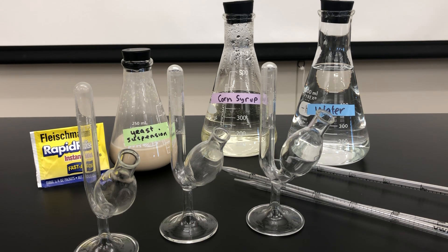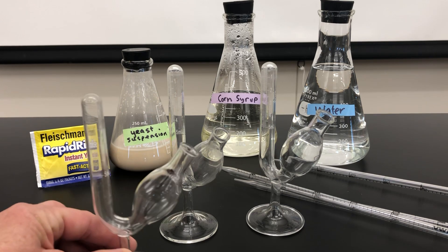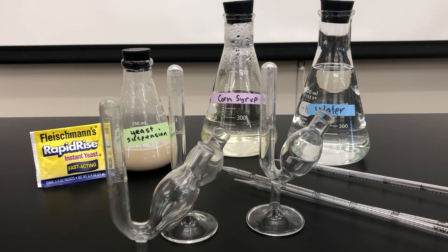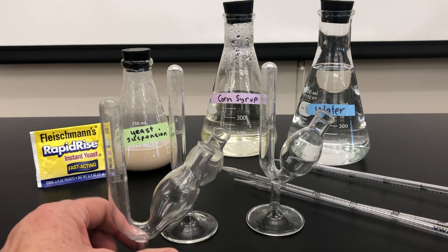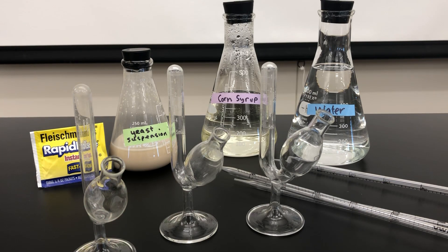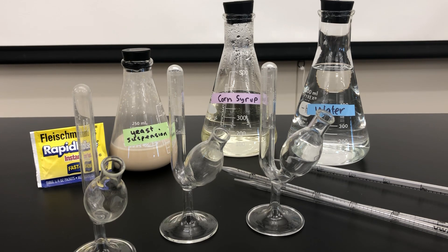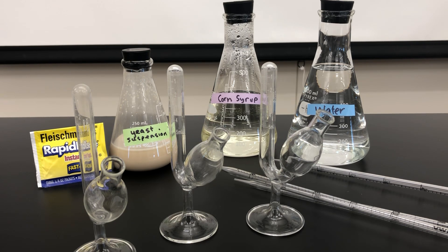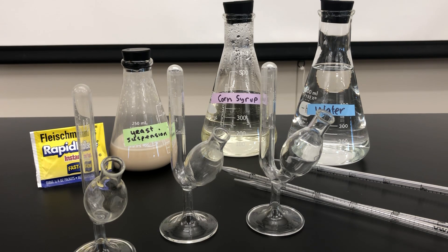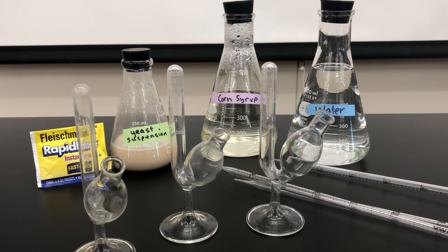In order for fermentation tubes to work, the total volume must be enough that we can drive the liquid into the graduated stem. That is the reason we are changing the amount of water. The water is really to keep our volume consistent, and we know water serving as a controlled variable won't alter our results. So it's really the amount of yeast that is different between these three fermentation tubes.